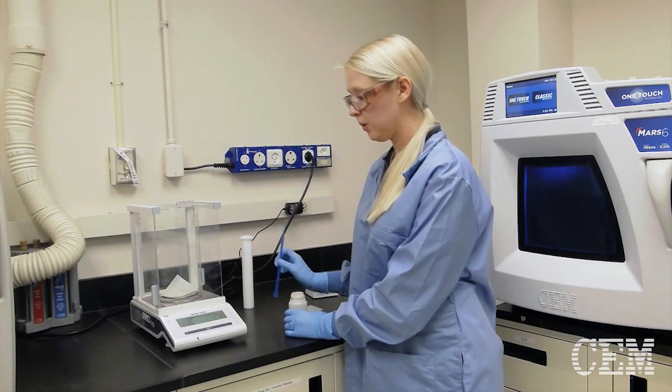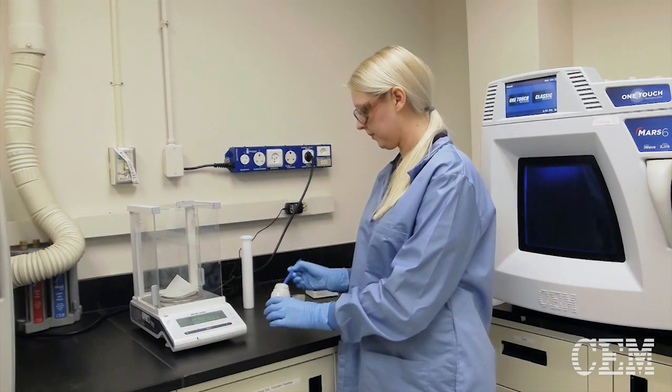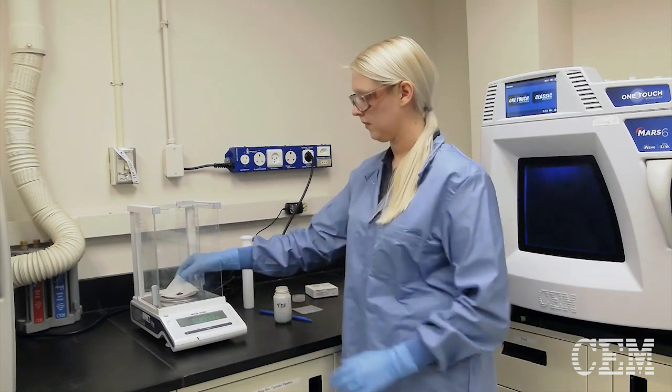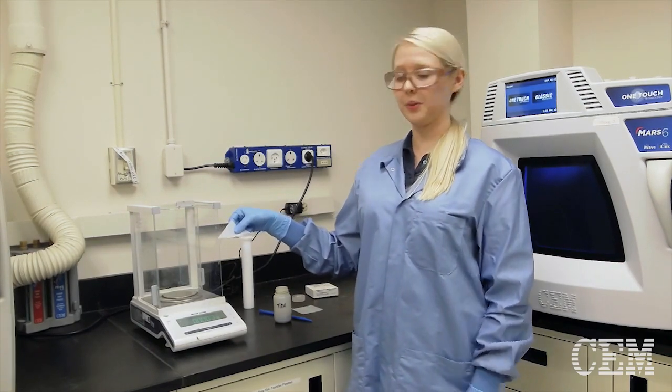So I'm going to weigh sample onto the weigh paper. And just like that, I have a sample that I can easily transfer to my vessel.